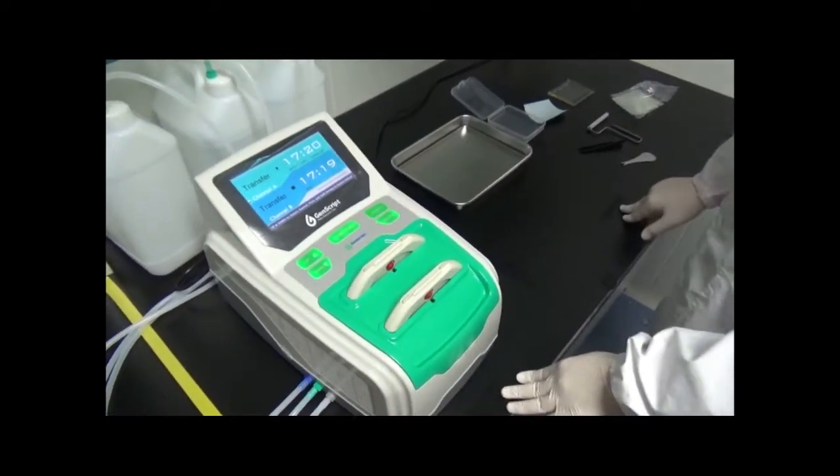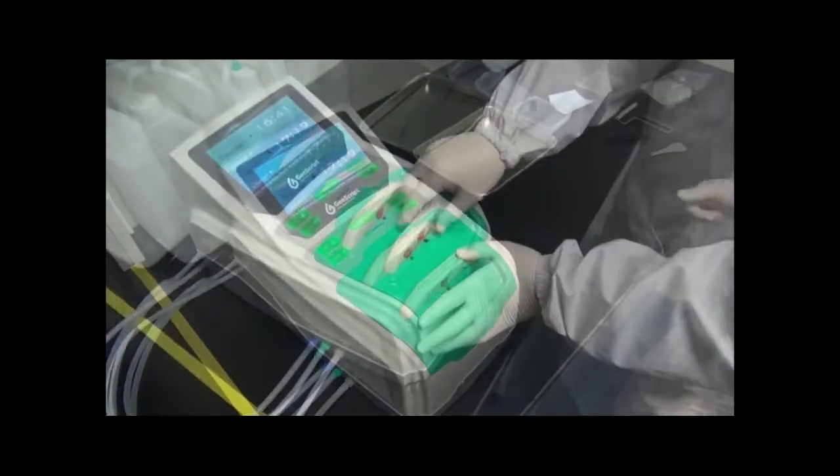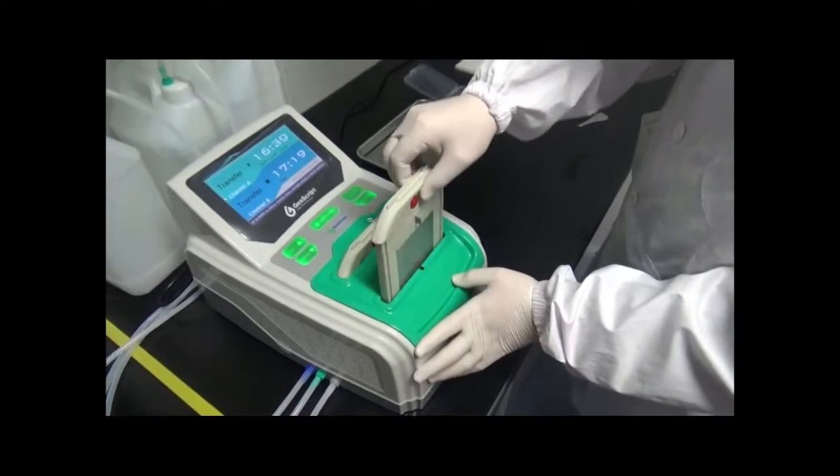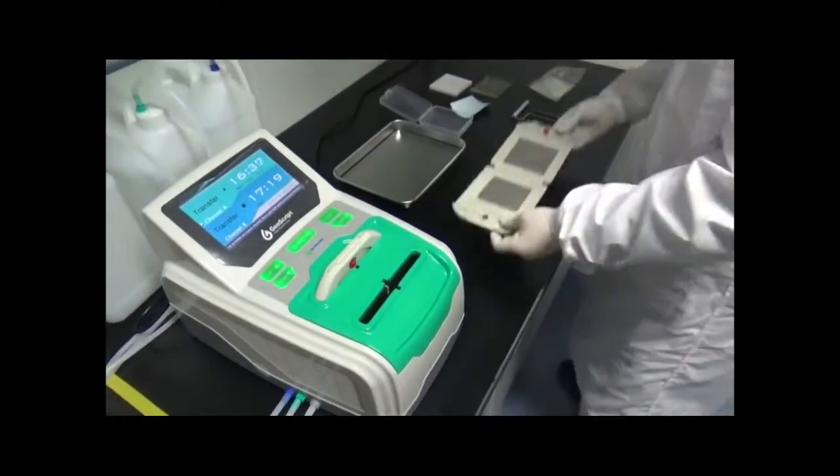Perform the same sandwich assembly process for channel B. The two channels are independent from each other which allows for maximum flexibility.